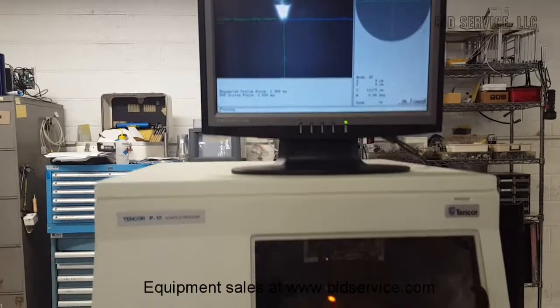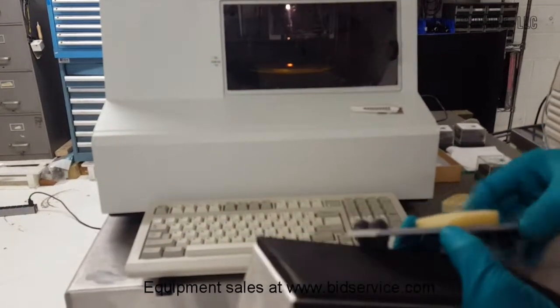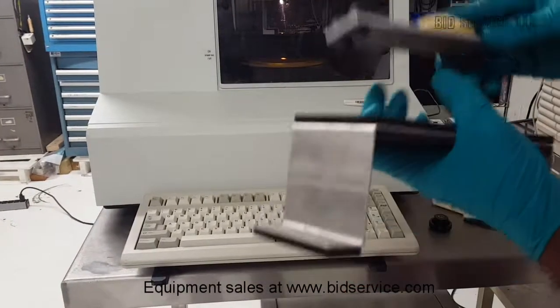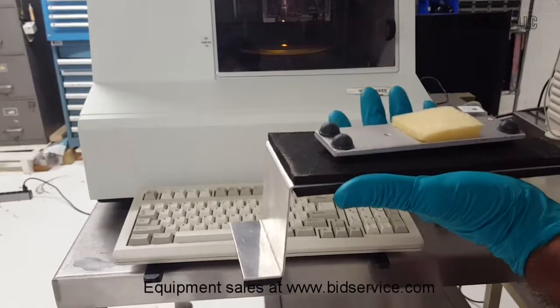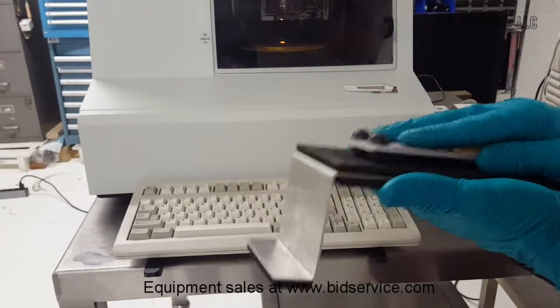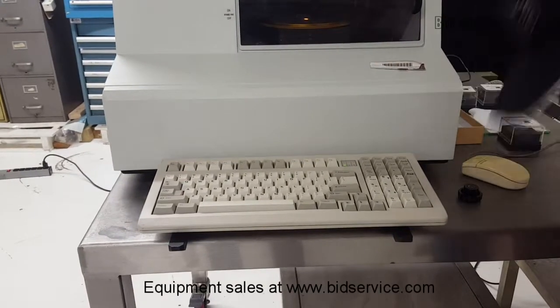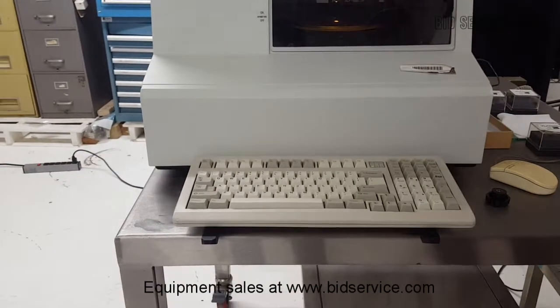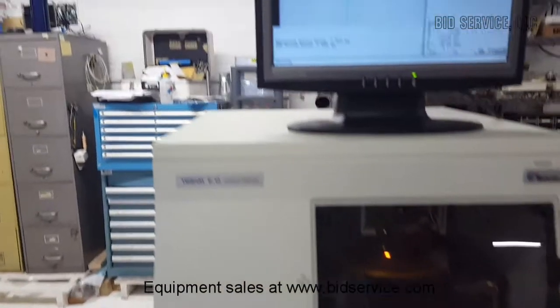So these brackets will be placed on the stage, and this foam keeps the sensor locked in its position. So before powering up the system, please remove these brackets and make sure you save them for any time you need to relocate the system again for future use.